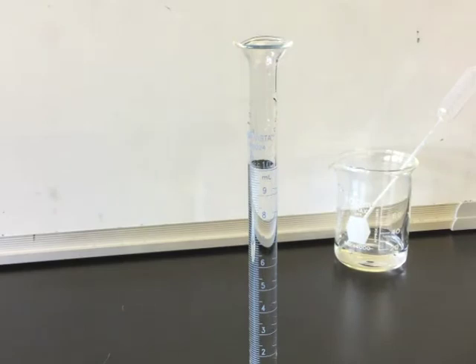Now that I'm at precisely 10 milliliters, I can use that as my volume. Alternatively, I can use a lower volume than 10 milliliters and just record it to the precise number of digits, two numbers after the decimal point. This will leave me with only three significant figures, instead of the four that I have with 10.00.